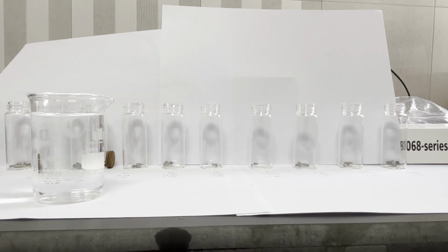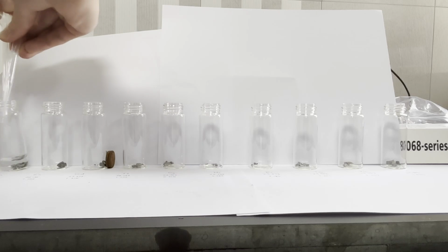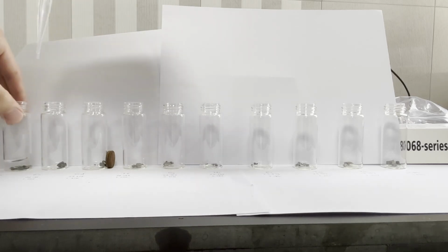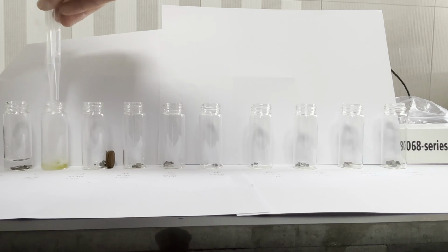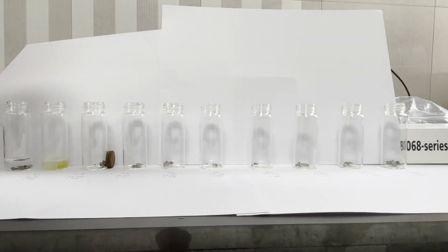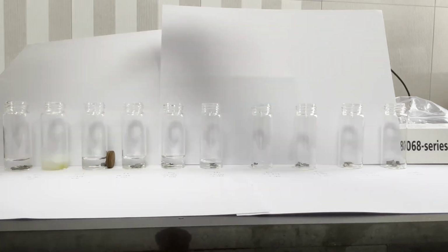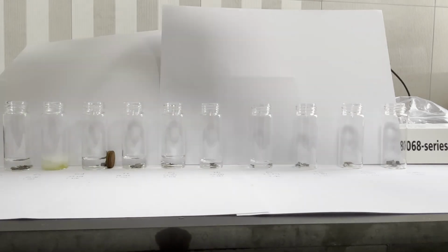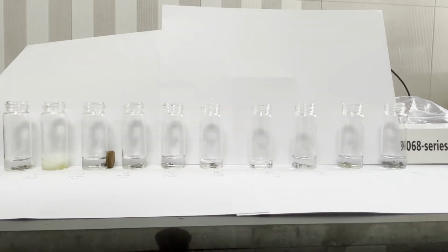I have here a beaker of deionized water, and I added around 5 ml of water to each of the vials containing the rare earths. Samarium didn't react significantly with water, but europium reacted very vigorously, giving off hydrogen and forming europium(II) and (III) hydroxide. All of the other elements didn't show reactivity against water. It is known that the reactivity of lanthanide elements decreases as the atomic number increases, and since most of the elements we have here are the heavy rare earths, they're not that reactive towards water.